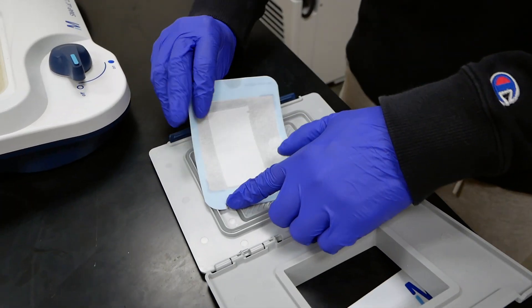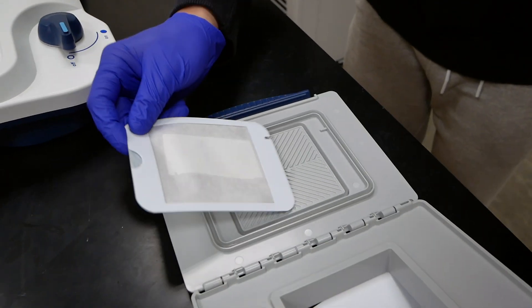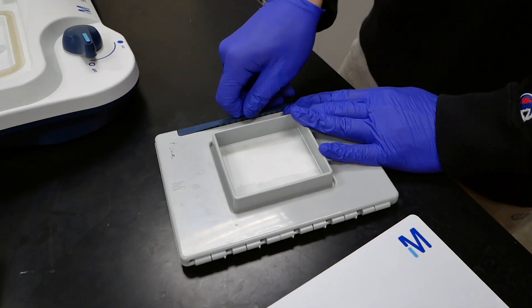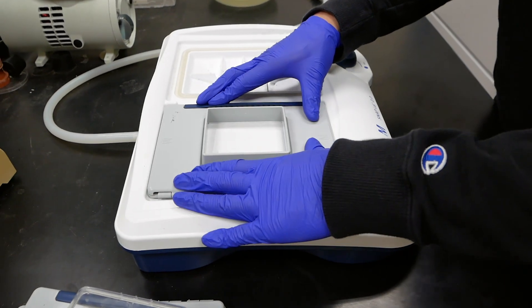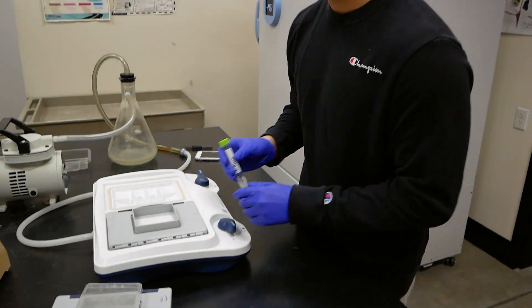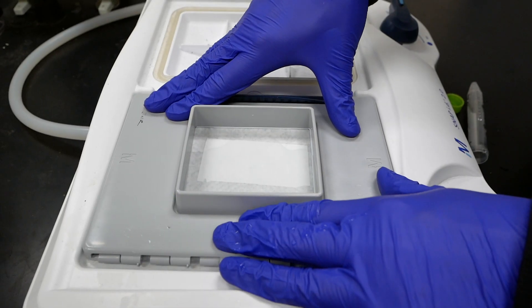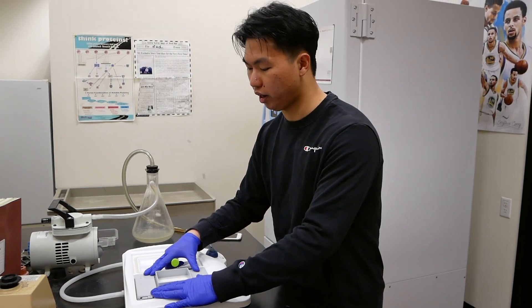Note that there's a notch on the blot holder and a protrusion on the apparatus — you have to make sure those align. From here, simply close the apparatus and move it onto the vacuum. We will be putting iBlock into the opening of the apparatus and turning on the vacuum. From there, we will hold it down for 30 seconds to ensure a good seal on the blot holder and the apparatus, and wait until all the iBlock is suctioned out.